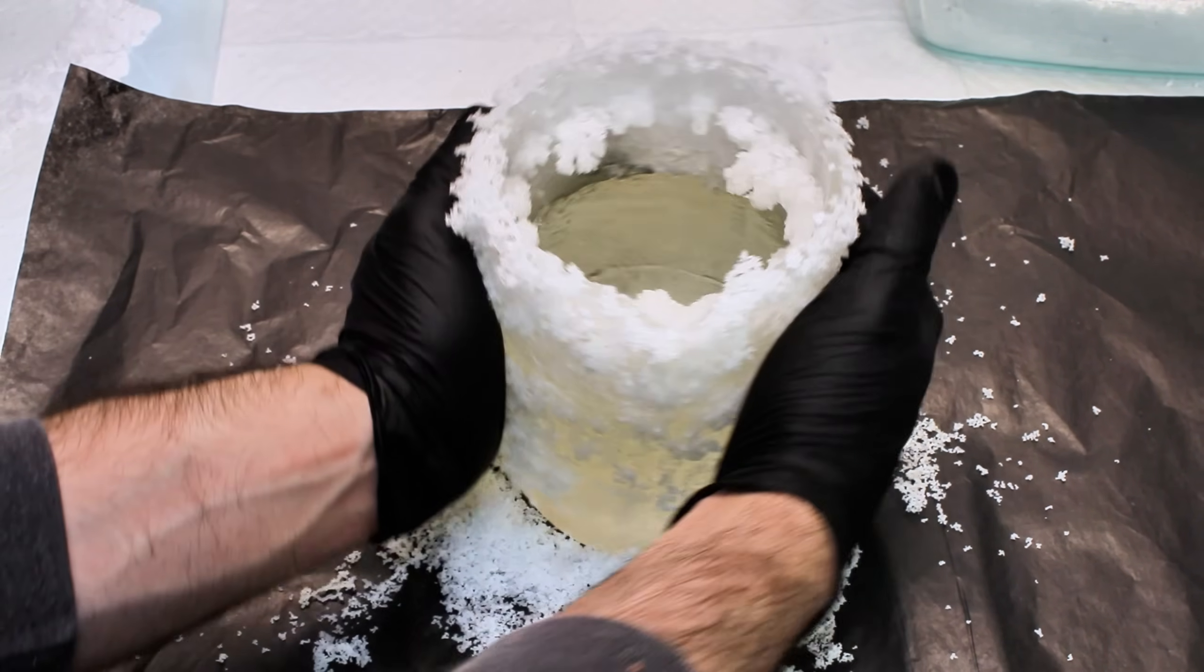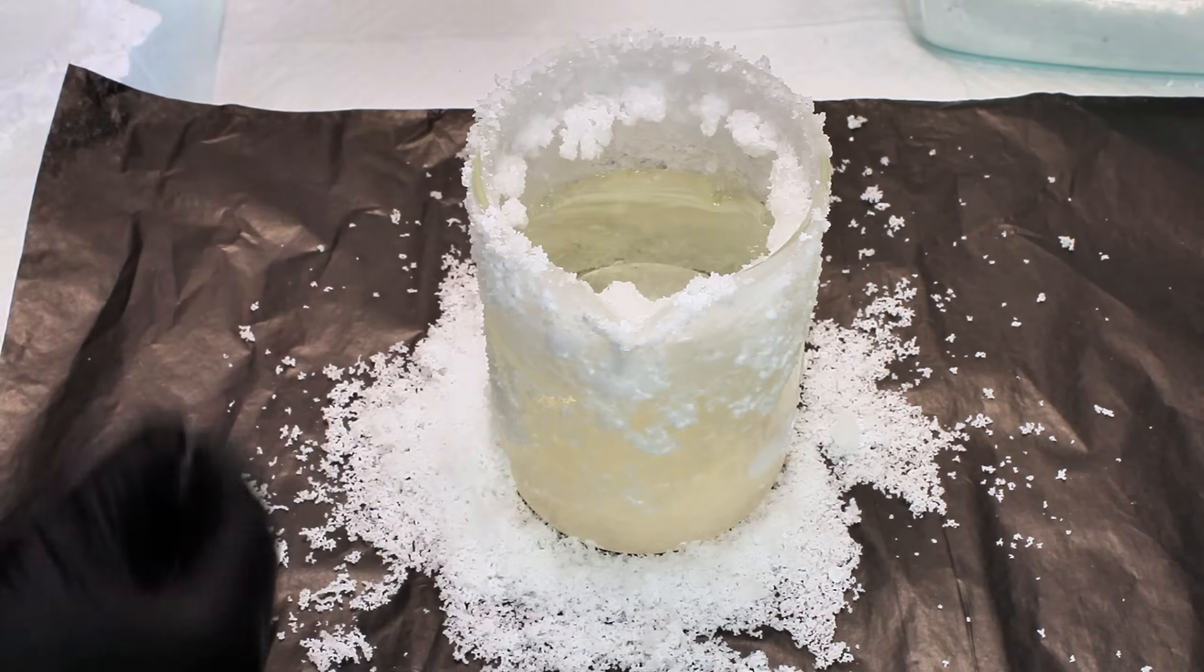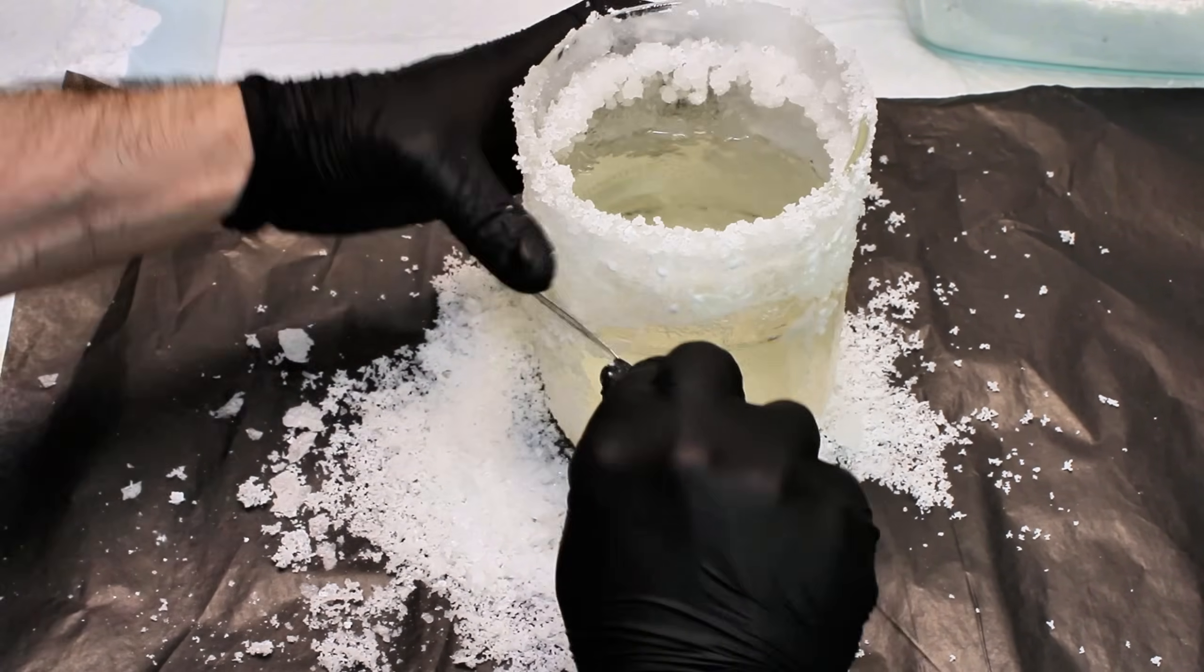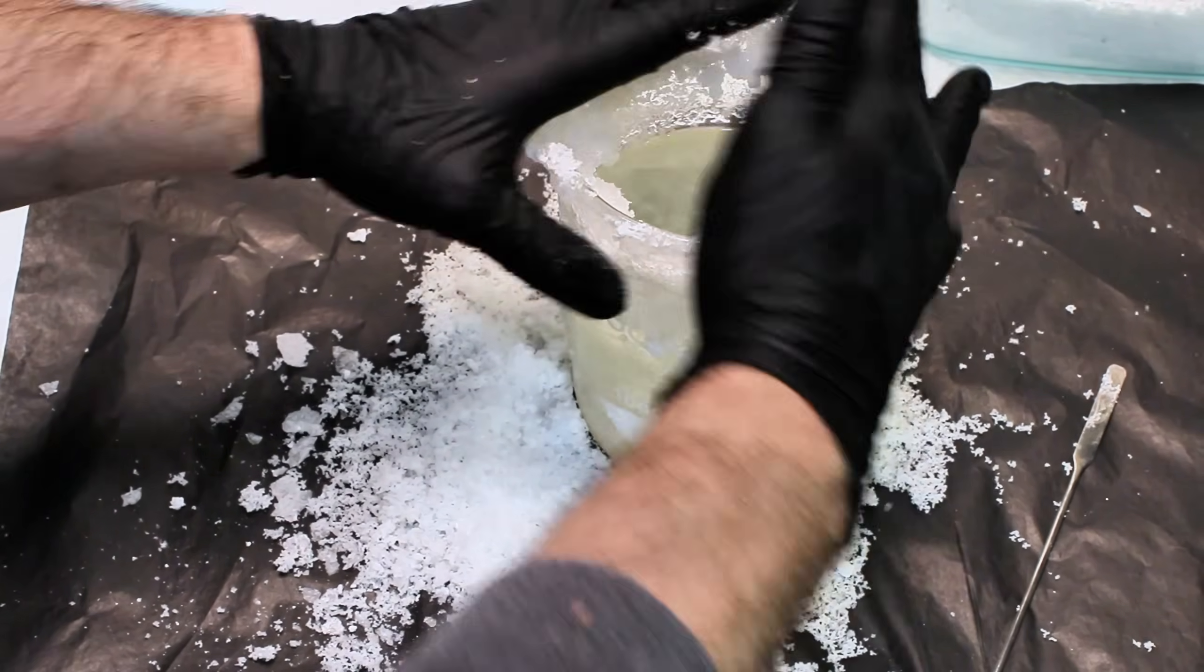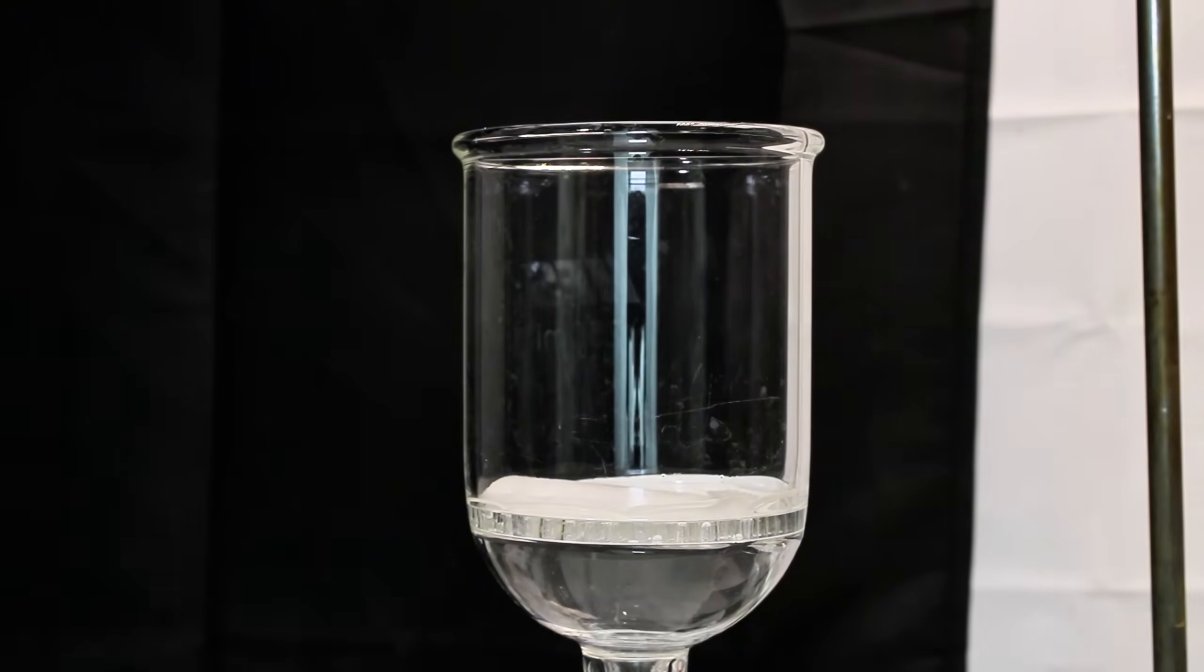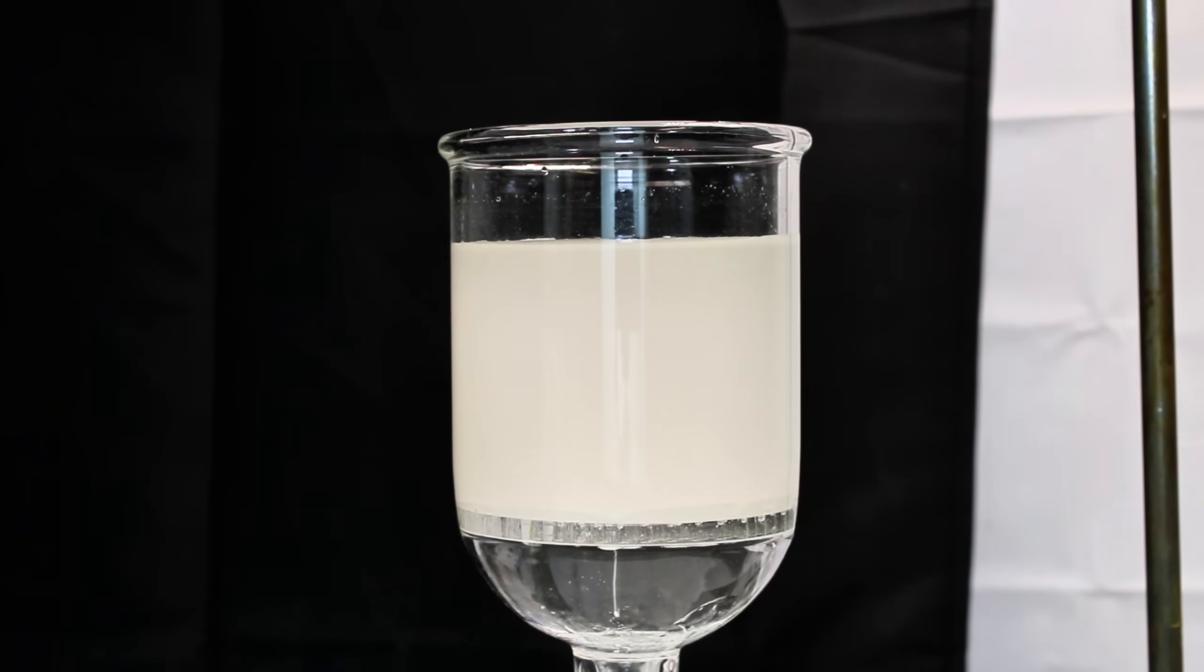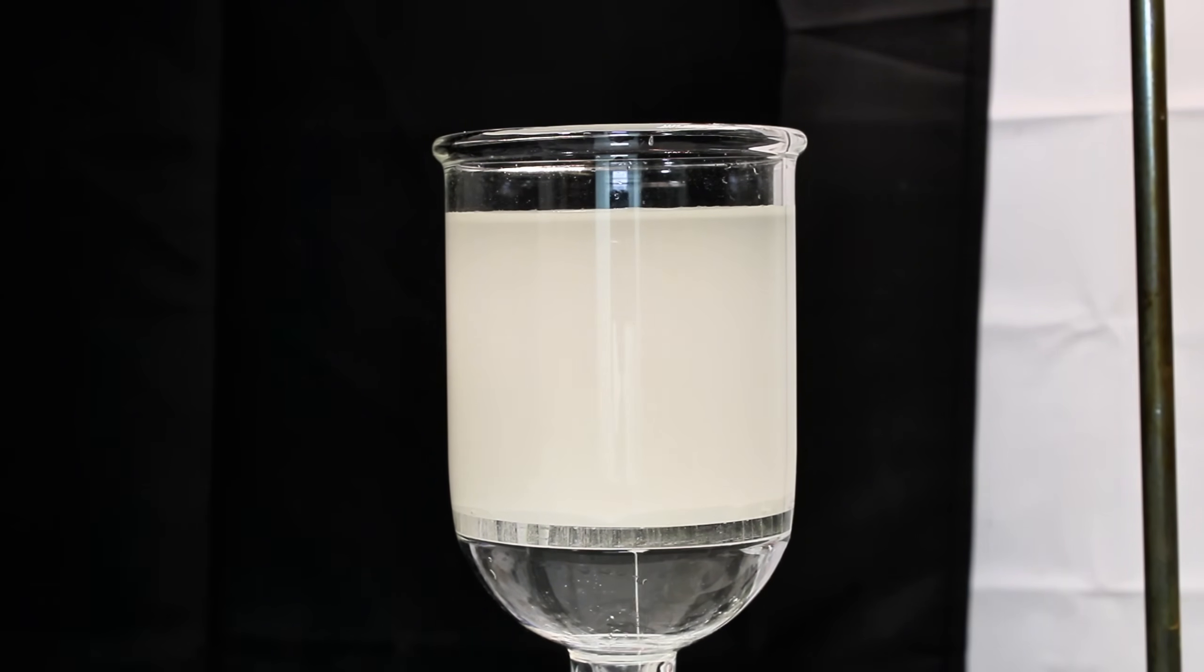I'm honestly kind of surprised this doesn't happen more often with a larger variety of salts, given the strong cohesive and adhesive properties of water. It's still really annoying to deal with, but all of the ammonium sulfate that had dried out this way is pretty much completely pure, and I collected it by simply scraping it off the sides of the beaker. Additionally, a good deal of salt did crystallize out of solution, which was the intent, and I collected that by vacuum filtration.